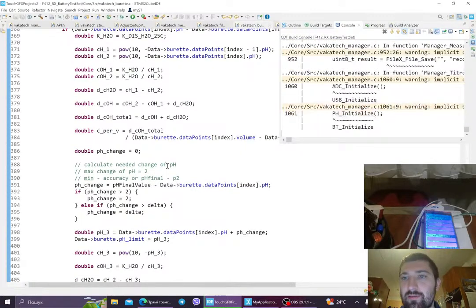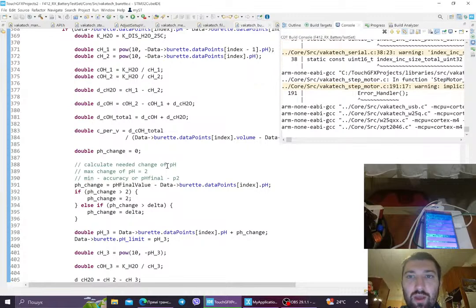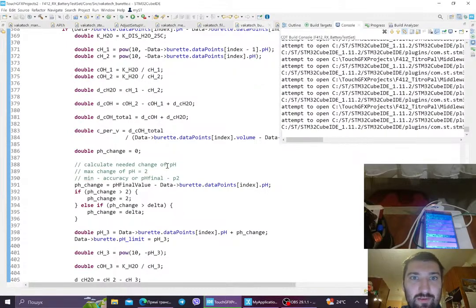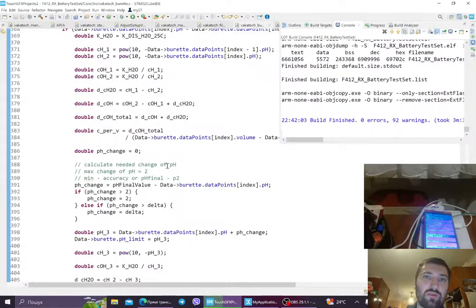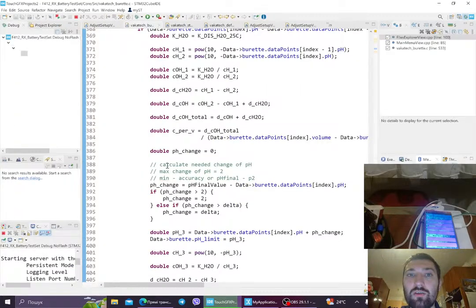And the problem is that sometimes you added a titrant, but nothing changes, and maybe even pH goes in the different direction, which is very bad. Also, you want to go to pH, let's say 8, and you've added sodium hydroxide, but at some point the task goes in a loop and you just overshoot. You go to pH 9, and it goes in the wrong direction, of course.